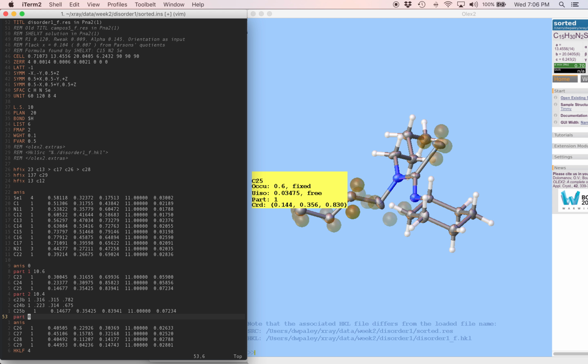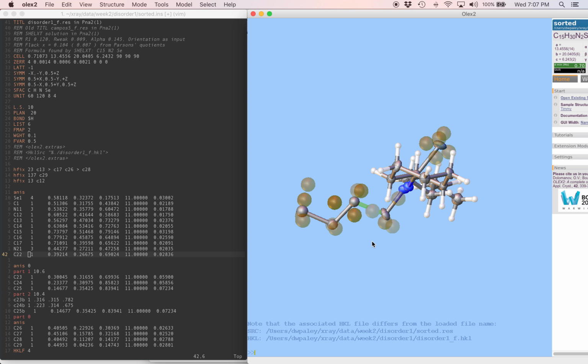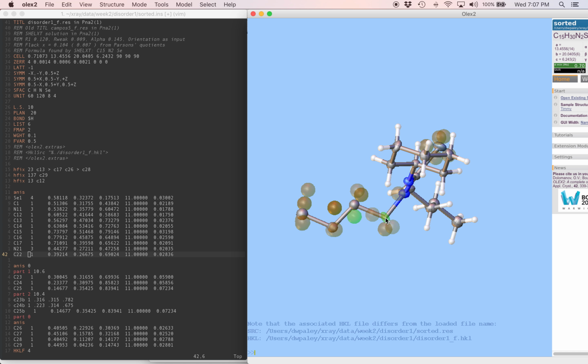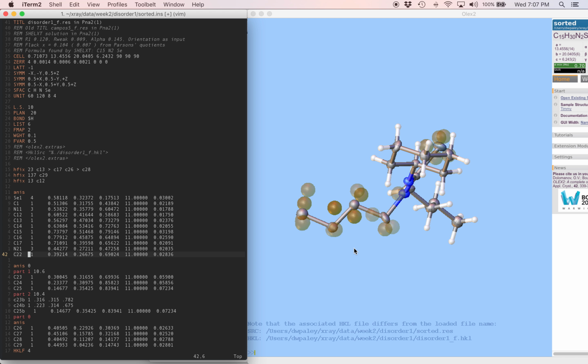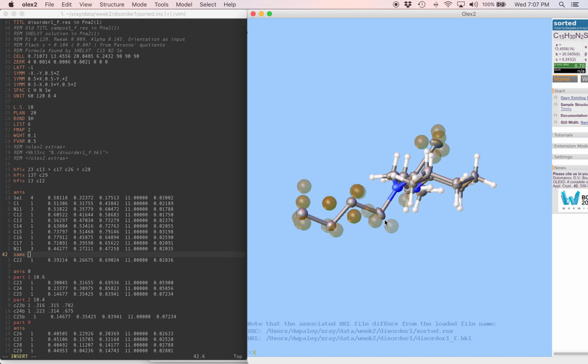And we need to remember we need some restraints to keep these two disordered parts chemically reasonable. Often all you need is to just say that the two parts should look like each other. So we're going to use the same instruction to do that. And we're going to start one atom before the disordered part because we want to make sure that this bond is the same length as the new bond that we're making between C22 and C23B. So the same instruction is going to come before C22, and we're saying that C22, 23, 24, 25 are the same as C22, 23B, 24B, 25B.